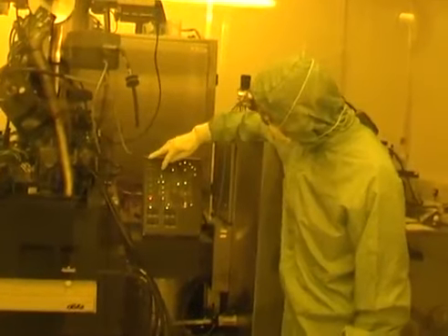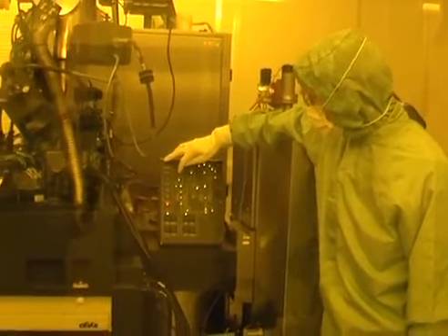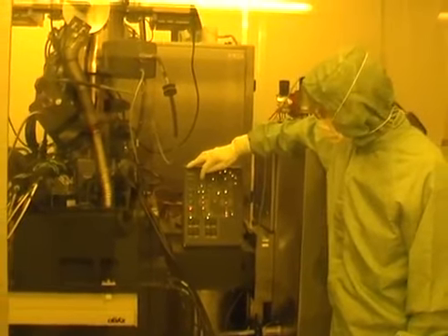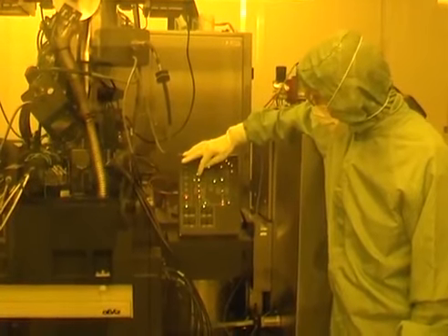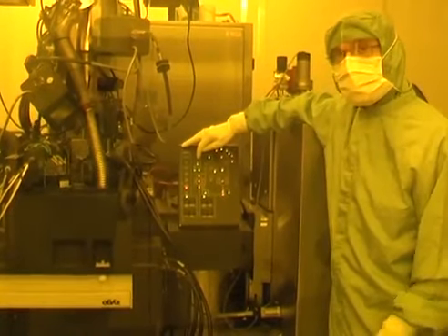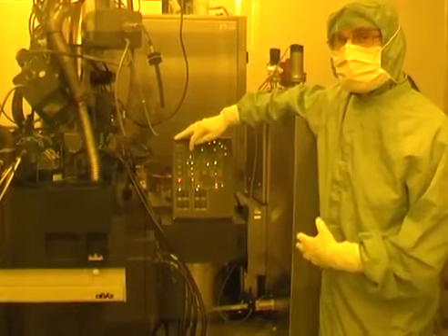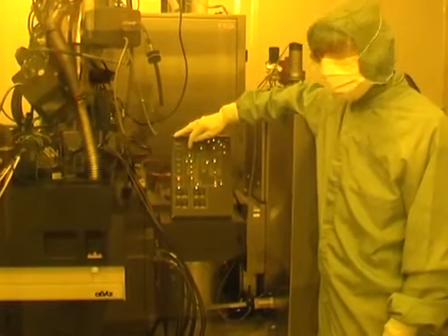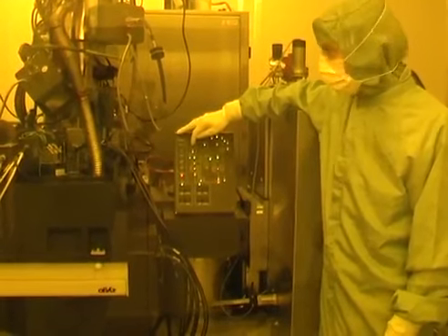The light here is this one, which is labelled PE1, which is the penning on the load lock area. When this lights up, that tells us that the load lock is under vacuum, and we're then able to load our holders onto the stage. So nothing else can happen for the time being until this light lights up.